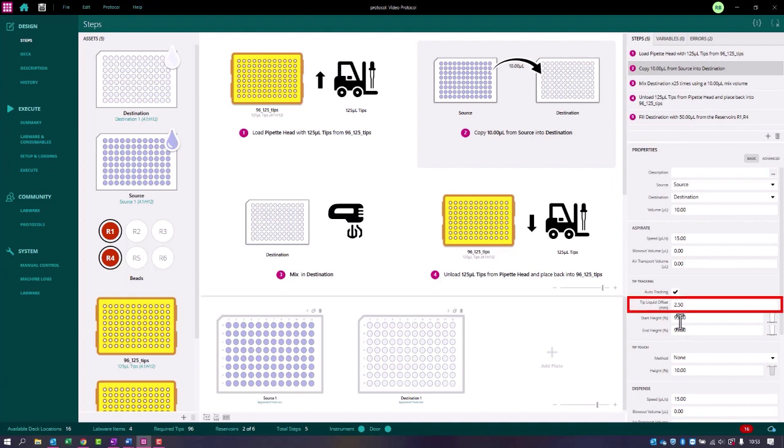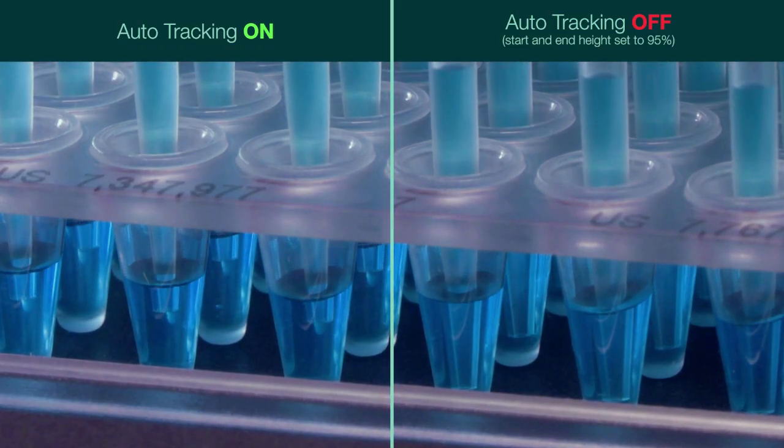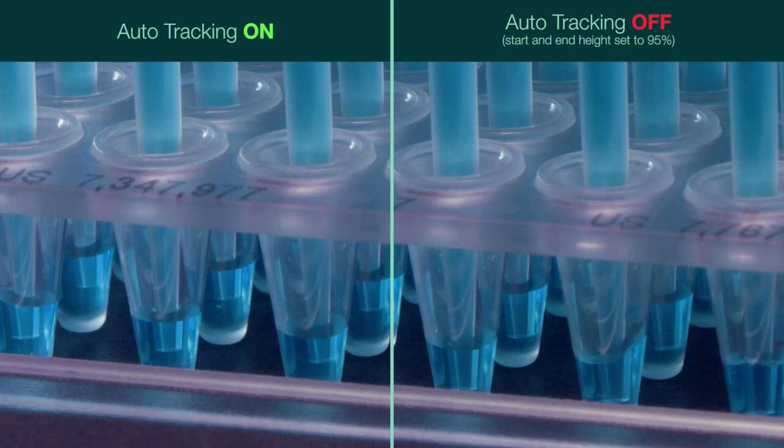This allows the user to control the depth the tips are below the liquid surface. This should be 0 if auto tracking isn't being used, to ensure correct start and end heights. In this example, you can see auto tracking on the left-hand side and a defined start and end height of 95% on the right-hand side.